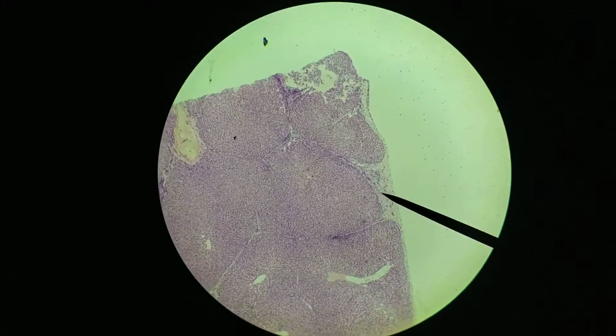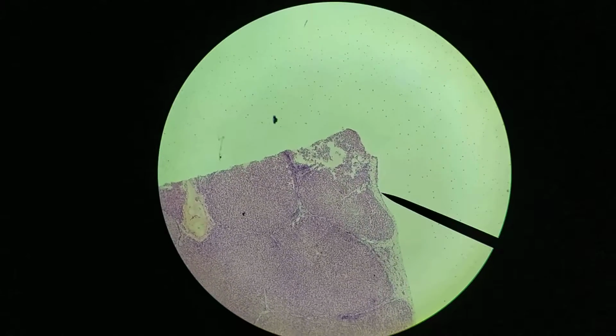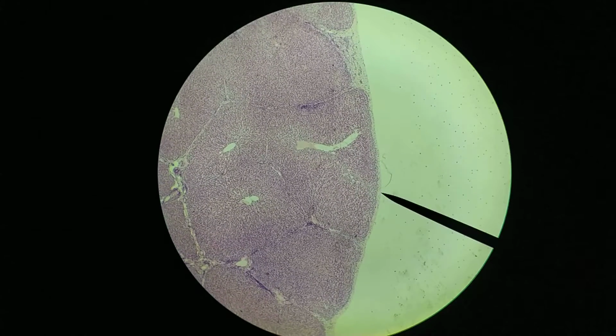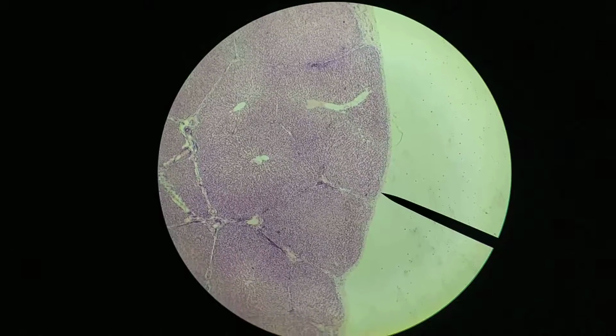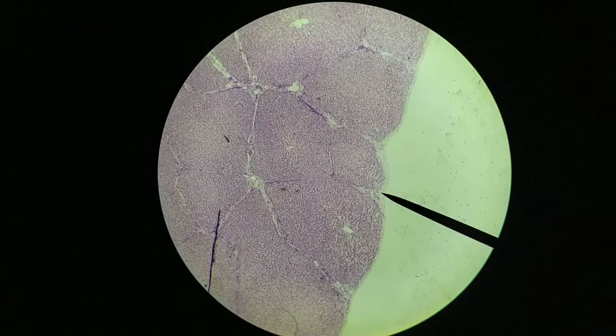For example, out here we have a bit of connective tissue visible that goes all the way around, you can see here and here. This is the Glisson's capsule, and as you can see, this capsule invaginates into the interior to subdivide the liver into lobes and lobules. You can see a bit of that here and here and here again. It's a bit of connective tissue just going into the interior.